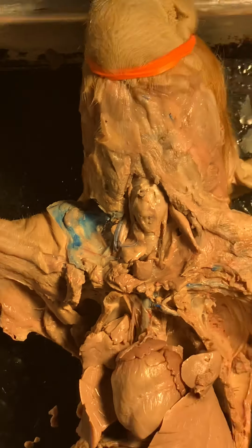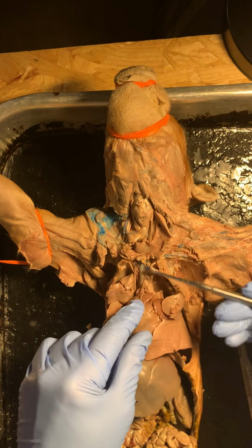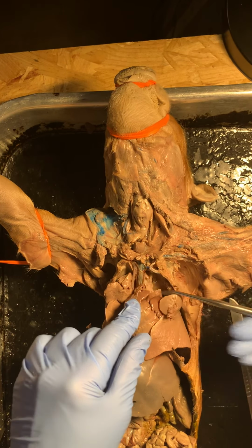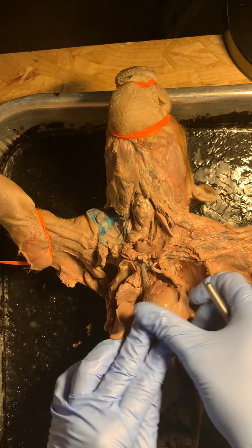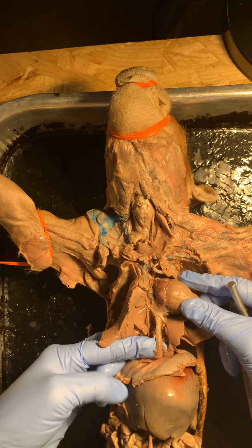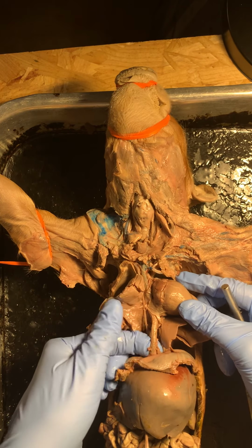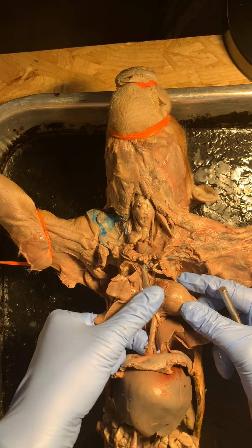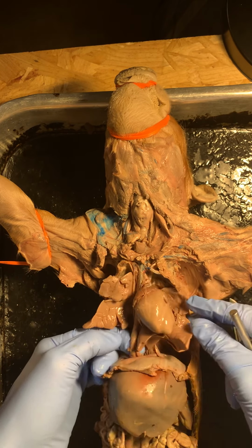chest cavity. And we have coming into the heart here, you have your superior vena cava right here, okay? And then if you have a superior, you're going to have an inferior vena cava. So you have your inferior vena cava just piercing through that diaphragm right there. Both of those inferior vena cava and superior vena cava converging on that right atrium there.